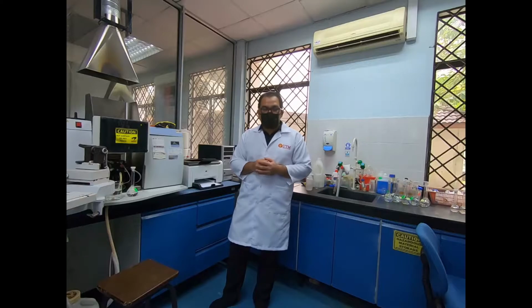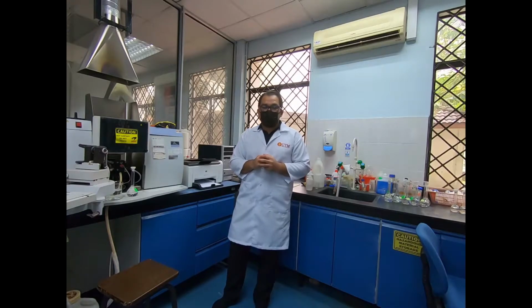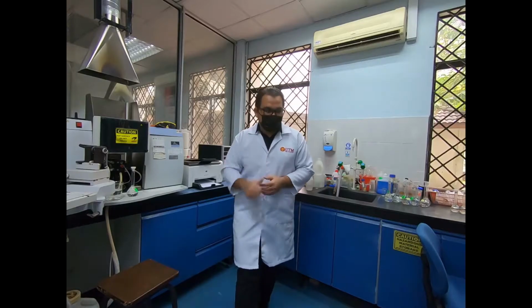Quantitative analysis requires accurate and reliable measurements that relate to the composition of the sample. In instrumental techniques, the proportionalities need to be practically established in the calibration procedures. In a typical simple calibration, a range of standards is prepared containing varying amount of the analyte. So now we are going to use this technique to determine zinc in our sample using AAS.